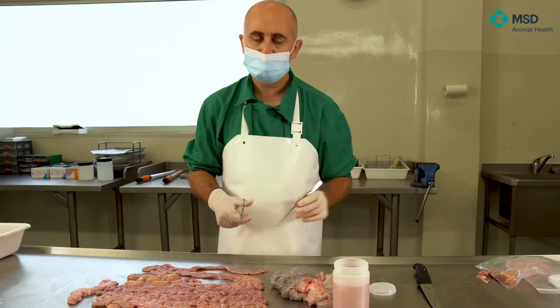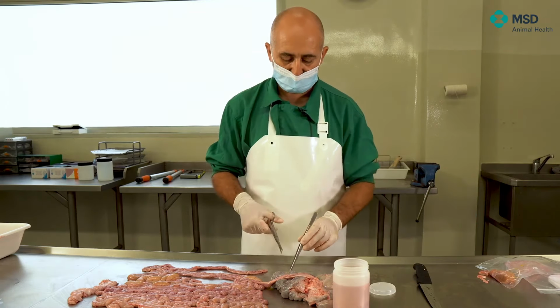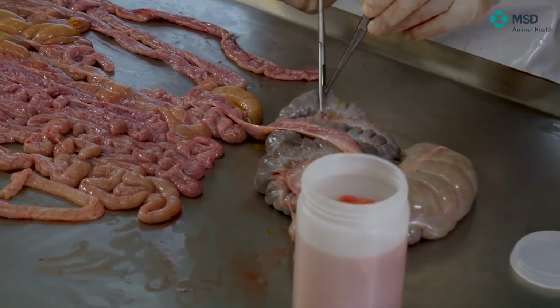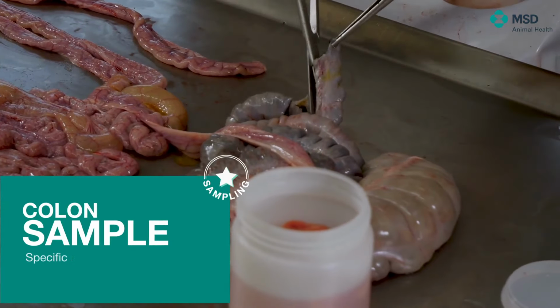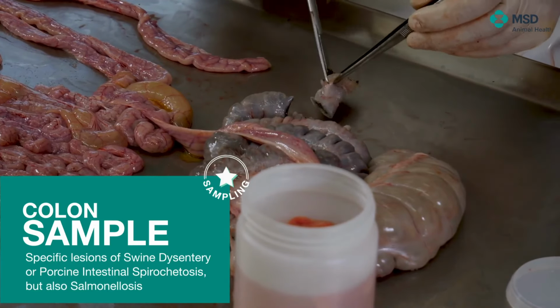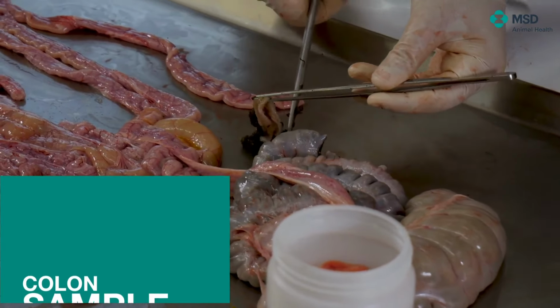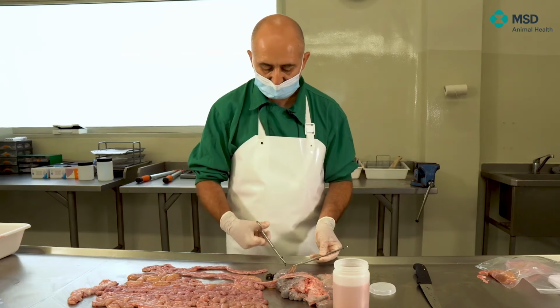Of course, at this stage, we have the large intestine. As I told you, if you want to make any bacterial isolation, we will perform similarly to the small intestine. And if we want to do some histopathology, we will also cut small pieces, 4 or 5 centimeters, to be opened longitudinally, and try to eliminate the feces, which is the most usual situation.